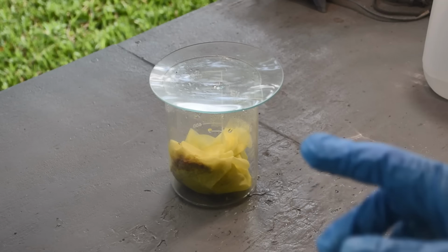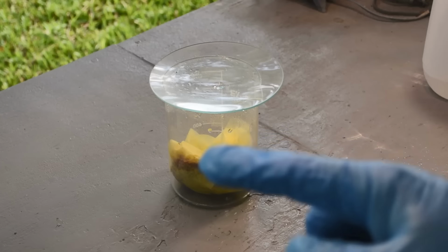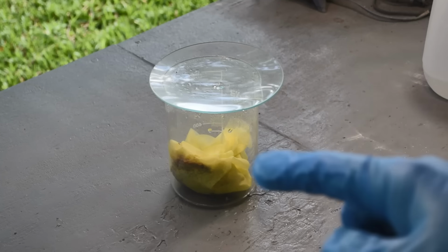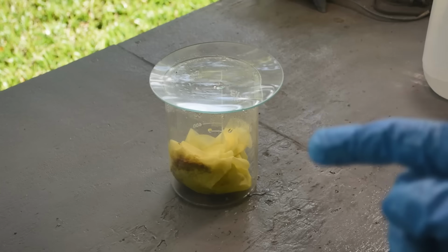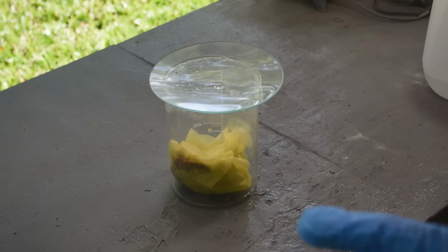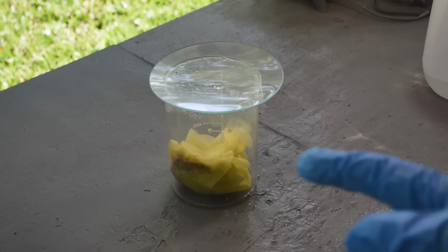So what I'd like to do is redissolve the red salt in these filters. Get it all into solution. Filter the solution really well to get any particulates out, including a lot of paper here and whatever else might be in there. And then use ammonium formate reduction to reduce the red salt back to metal. And I'm hoping a lot of the impurities, like maybe copper, nickel, any other base metals present, will stay in the solution when the palladium metal falls out of solution. So that's my plan. We're going to try it and see how it goes.